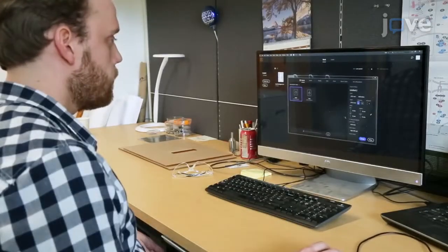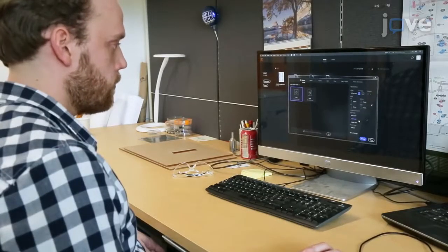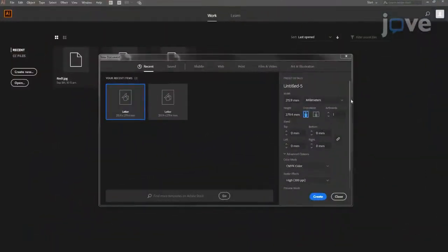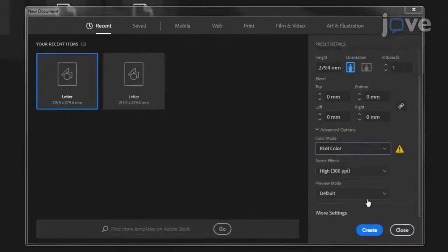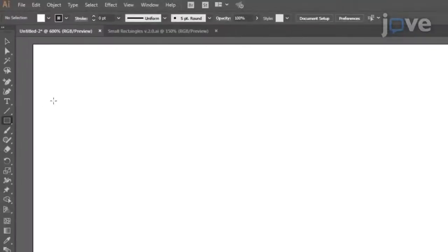Begin by opening a vector graphics program on a computer. To prepare the desired mold geometry in vector format, open a new canvas of appropriate dimensions with the RGB color format. Then, select the Shape tool from the left-hand panel and create the desired geometry by entering the dimensions at the top of the window to precisely define shape sizes.